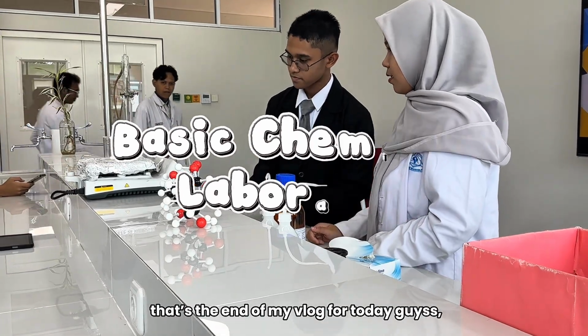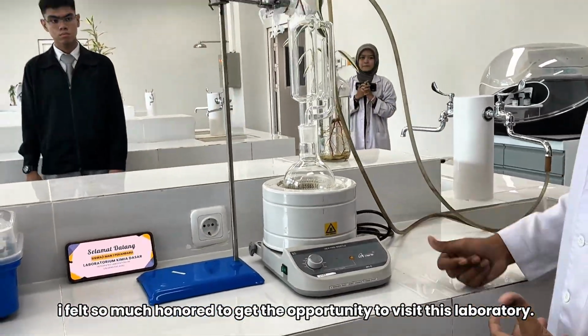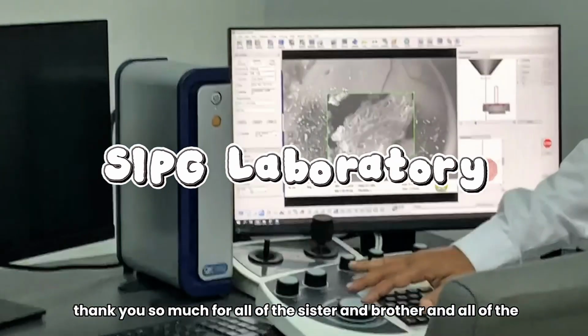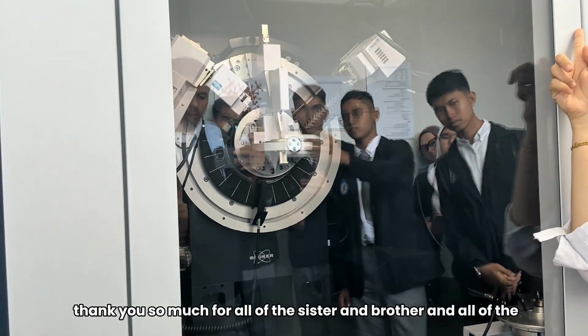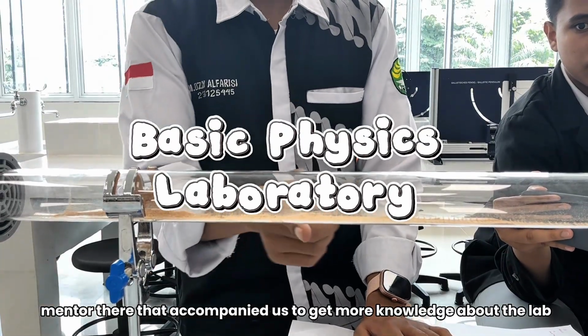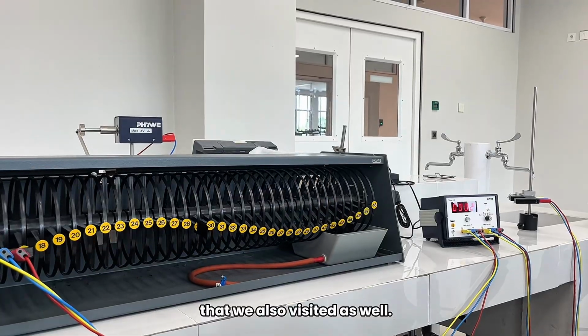This is the end of my vlog for today, guys. First of all, I would like to say that I felt so honored to get the opportunity to visit this laboratory. Thank you so much to all of the sisters and brothers, and also all of the mentors there that accompanied us to get more knowledge about the lab and equipment. And here are some of the labs that we also visited.